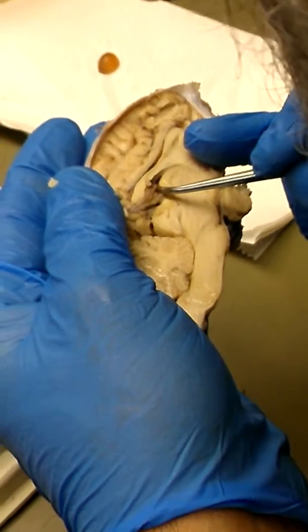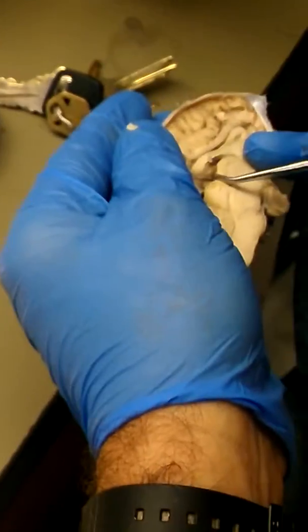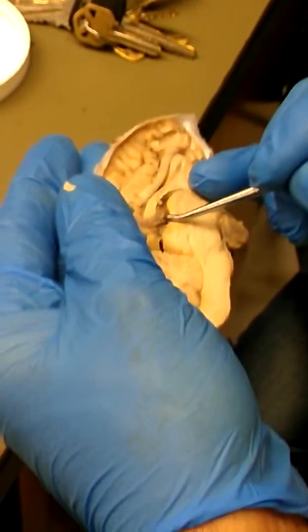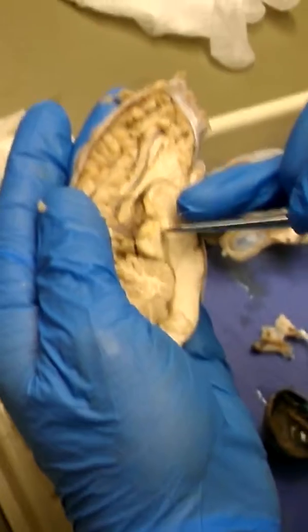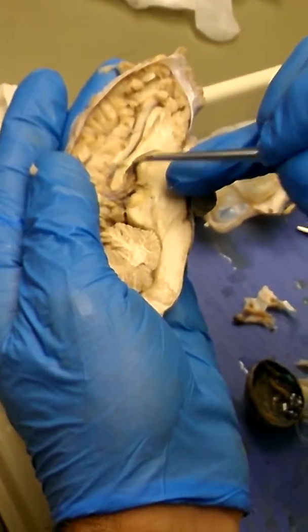See this fluffy tissue that's right here? I'm not going to ask you this, but this is in the roof of the third ventricle right here. This is the choroid plexus. And you'll learn in lecture that the choroid plexus makes cerebral spinal fluid. And it's really rare to see it so nice, but you can see the structure. It's really great right there, okay? Yeah, this is the choroid plexus. And then this right here is the cerebral aqueduct, which connects the fourth ventricle to the third ventricle, okay?